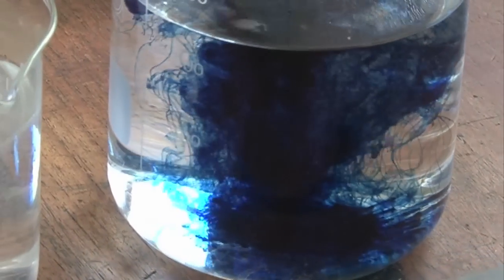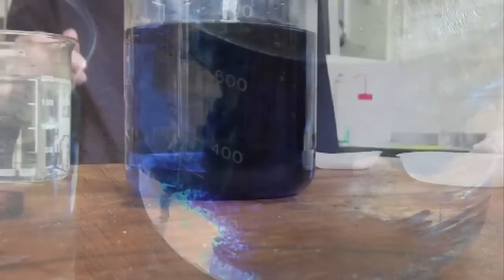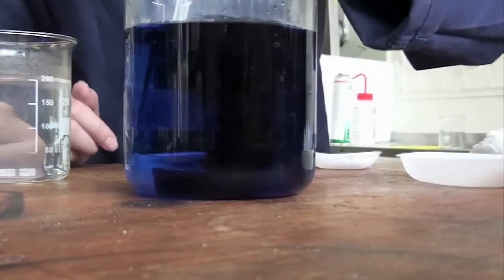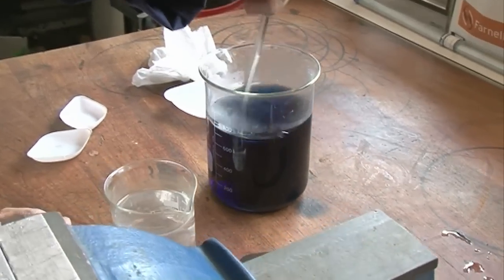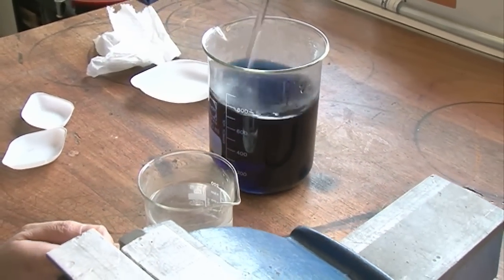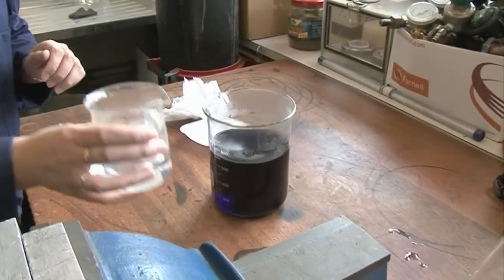You can see a really nice swirling effect. We're going to make sure it's fully dissolved in the glucose solution, so really want to make sure that indigo carmine, the glucose, and the water are all mixed together. We've got our blue solution here, we've got our colorless solution in here.